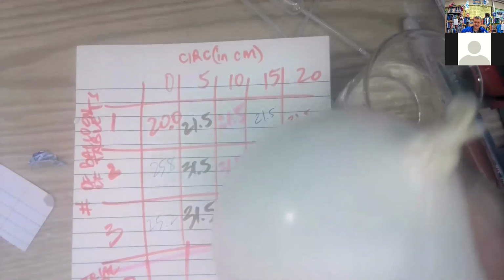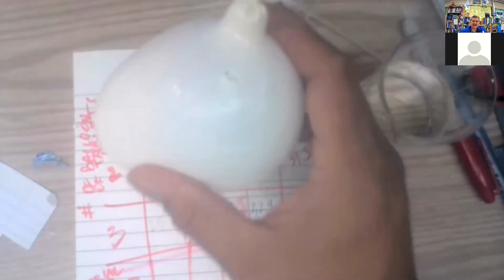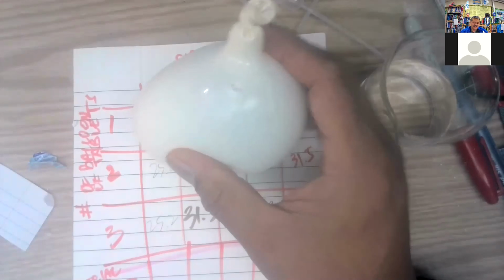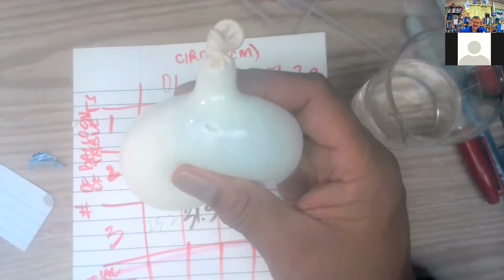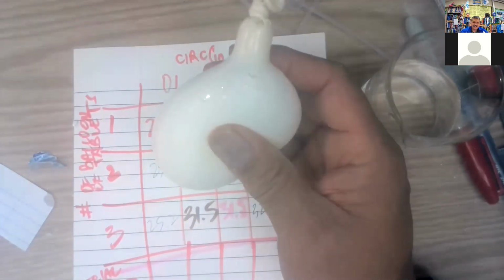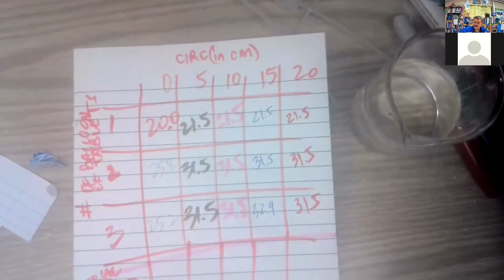But looks like I'm going to have to do it. Ooh, one more time. Yeah, look at that hole. Oh, now it's going away. Darn it. It's a good idea. But the execution wasn't quite there. Guess I popped it during the tie. So it was getting smaller. All right. So, ta-da. We're done.